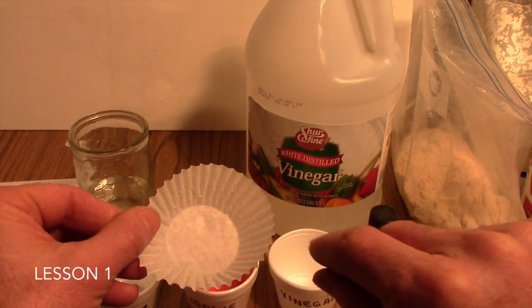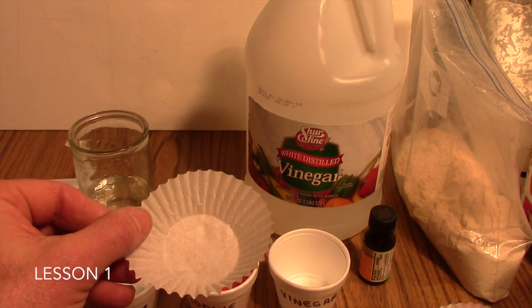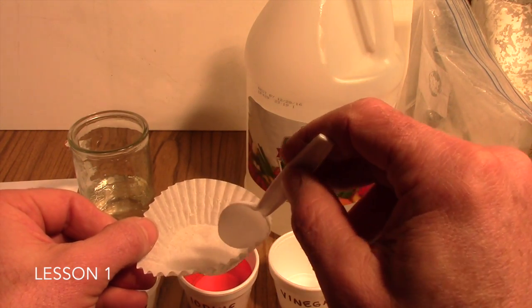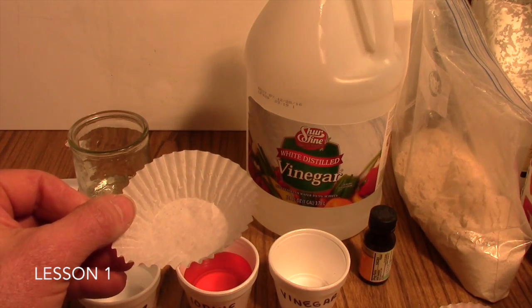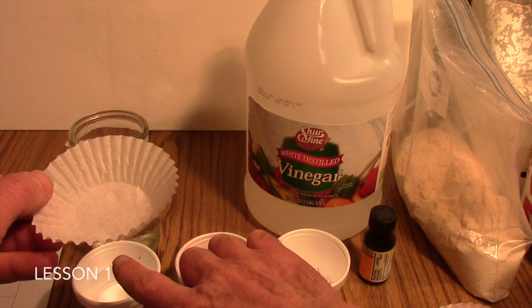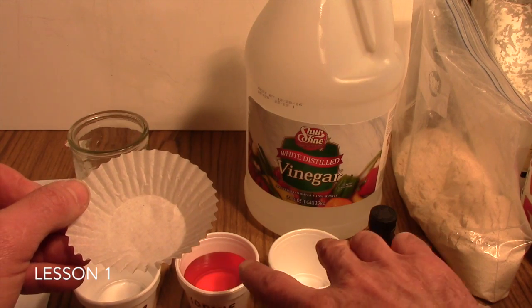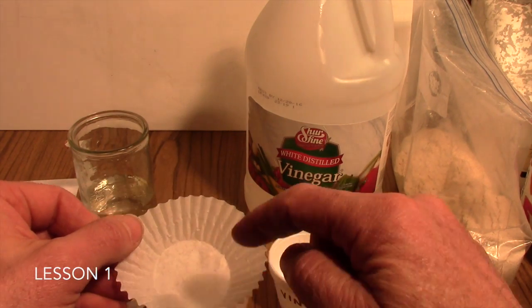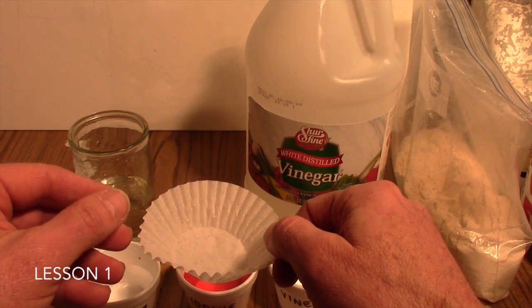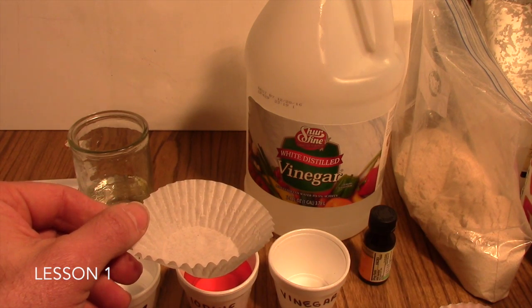And then the first thing you'll want them to do is go ahead with a clean spoon and divide that sample into 3 parts. Okay, divide it into 3 little piles there inside the cupcake liner, which will enable them to have a sample for each of their testing solutions. We don't want to mix these with each other and the powder all at the same time, because we want to get results that show a result from each individual testing solution.